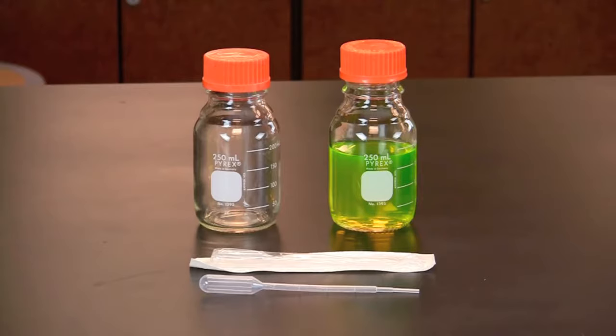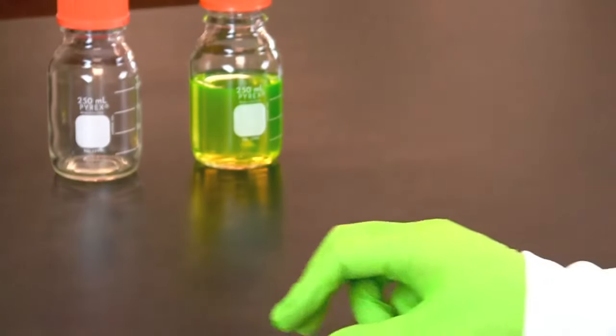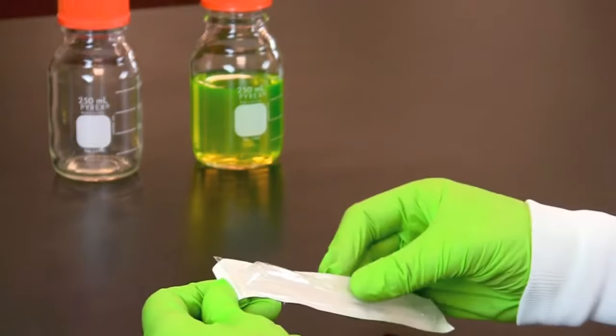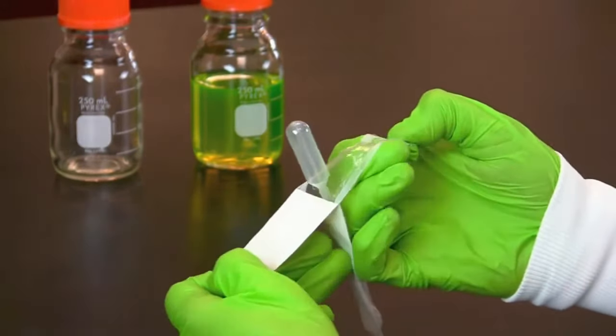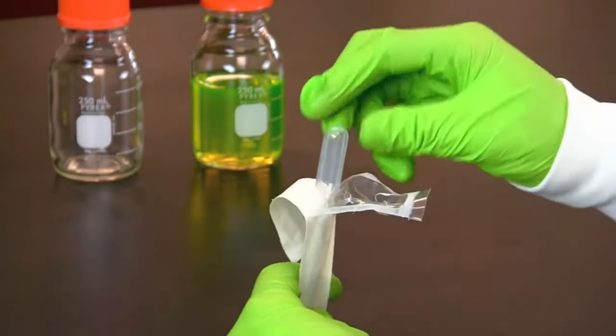In this video you will learn how to use a transfer pipette. We will be using a Disposable Plastic Transfer Pipette, or DPTP, also called a transfer or bulb pipette. Transfer pipettes are often available in individual sterilized packages for microbiological work.